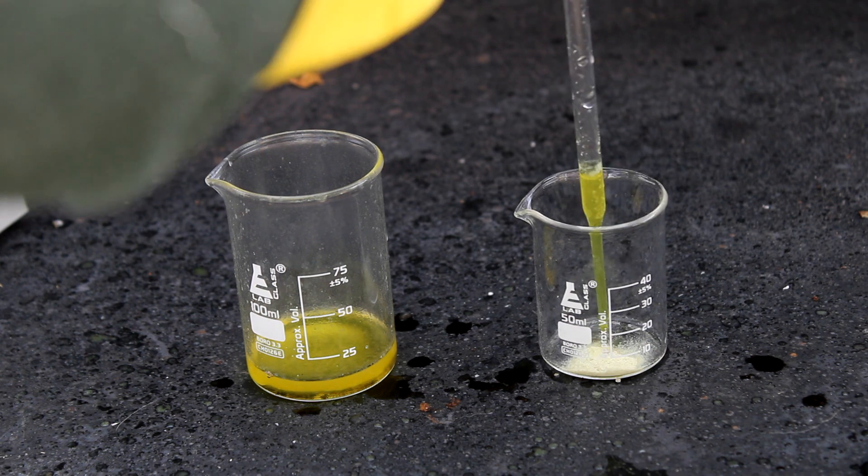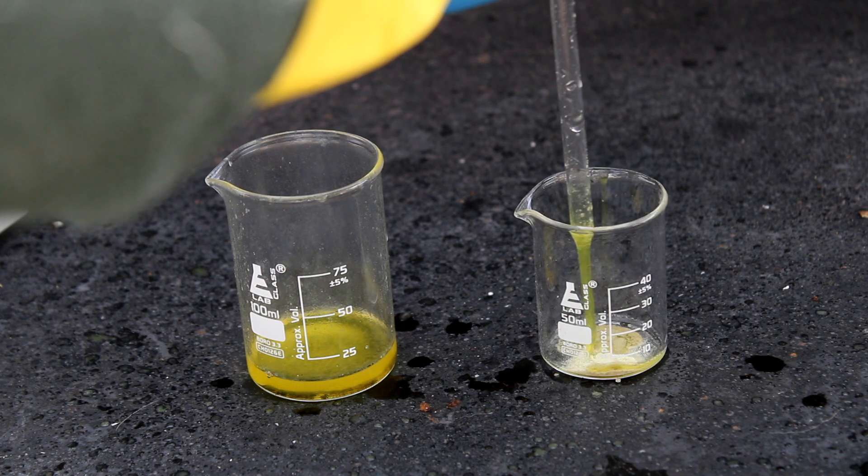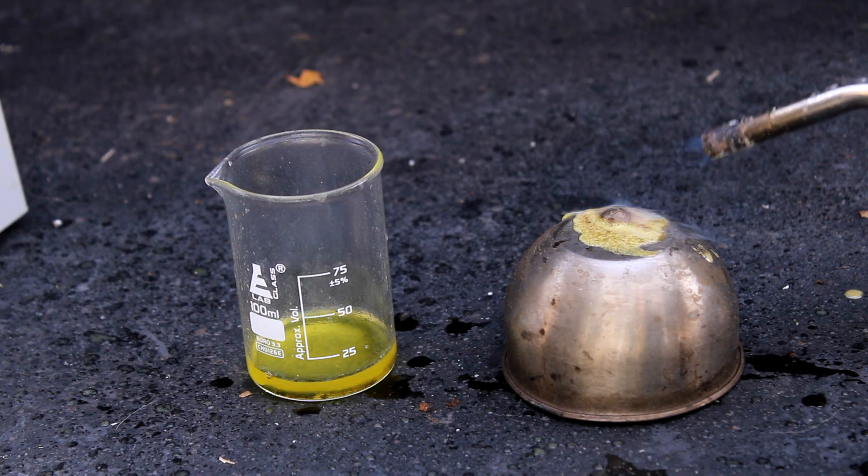Anyways, next, we have sulfur. I was hoping to see some kind of reaction, but nothing happened, even after I hit it with my blowtorch.